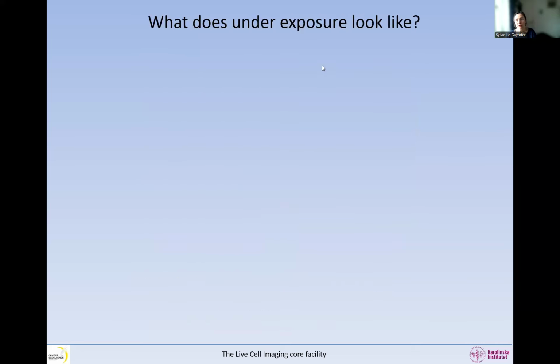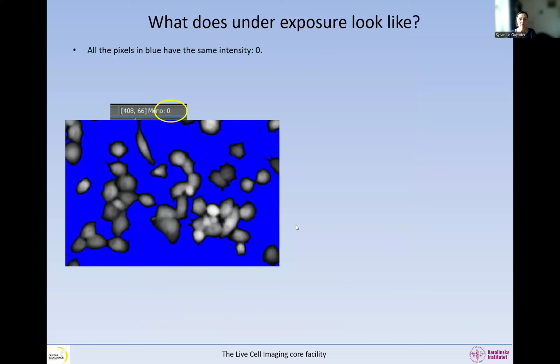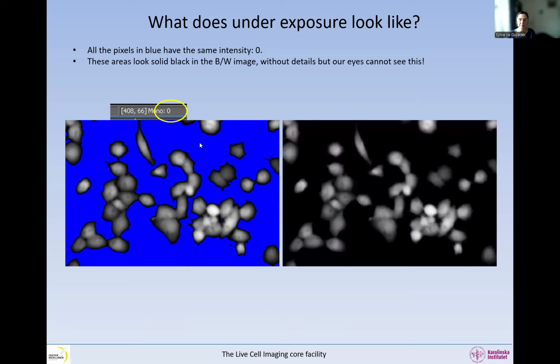So what about underexposure now? What does it look like? So this is an image that is underexposed. What you can see is that the background, when we use the color mask for saturation and underexposure, is solid blue. And if we look a little bit with our mouse at the intensity there, we see that all these pixels that are color-coded in blue have the same intensity, 0.